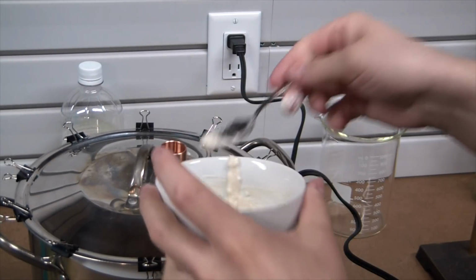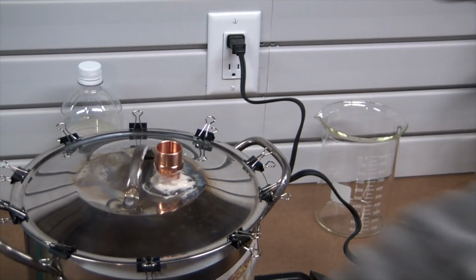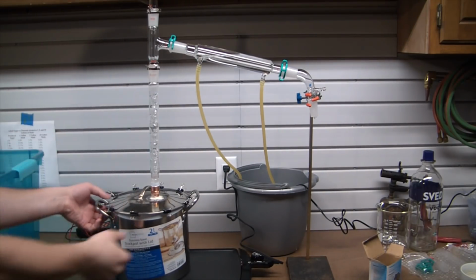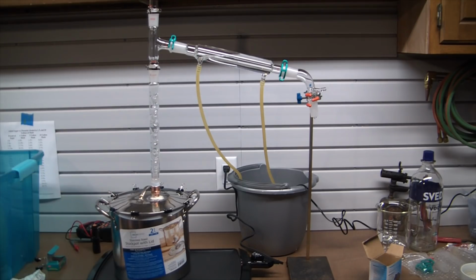Just get that in the connection there, since that'll be a leaker. Got some water and vinegar in the pot here. Lid sealed off with Teflon tape and a bunch of little clips. And of course the joint there sealed up with some flour paste.